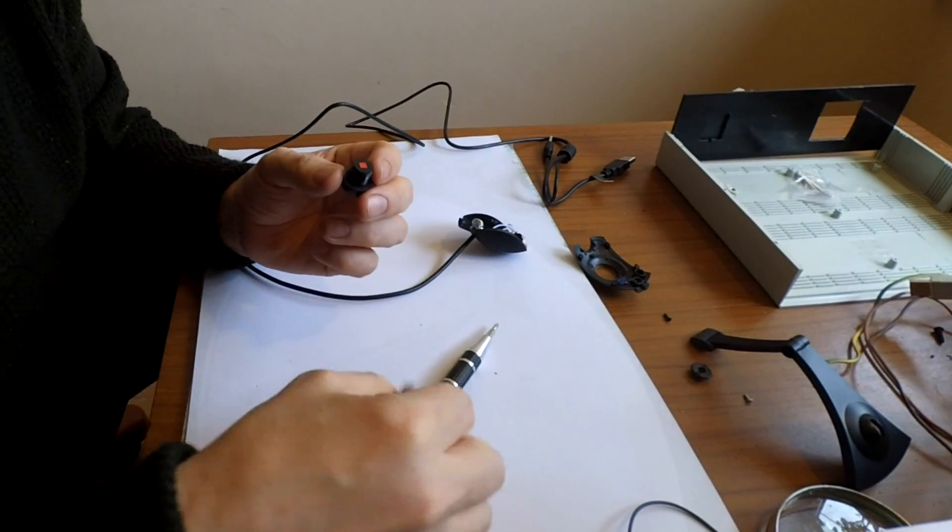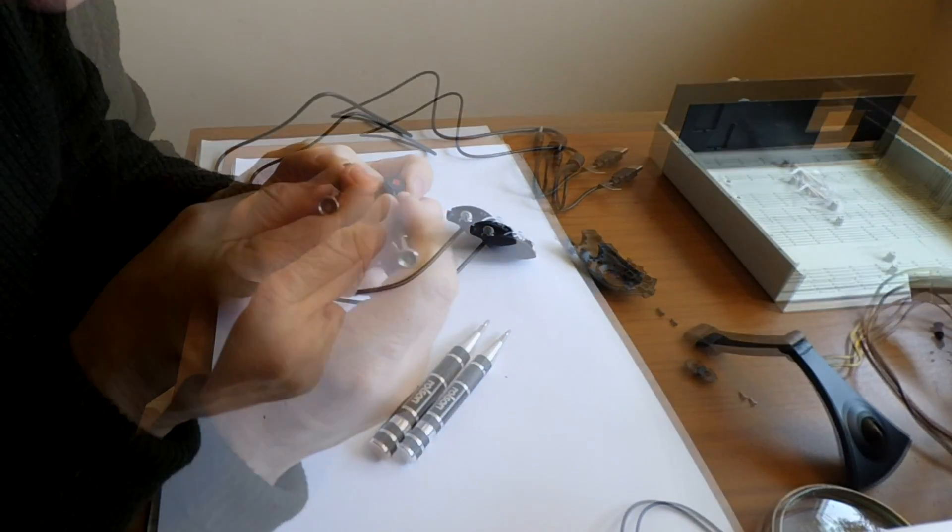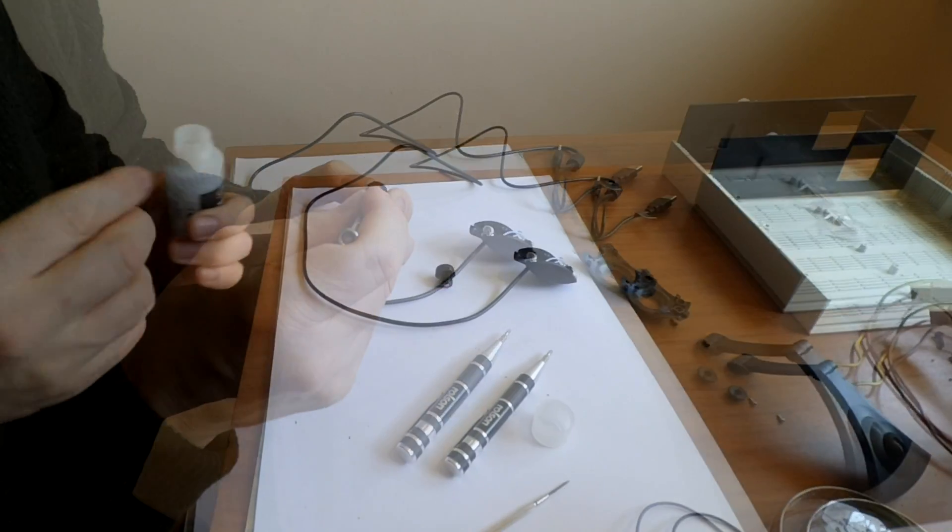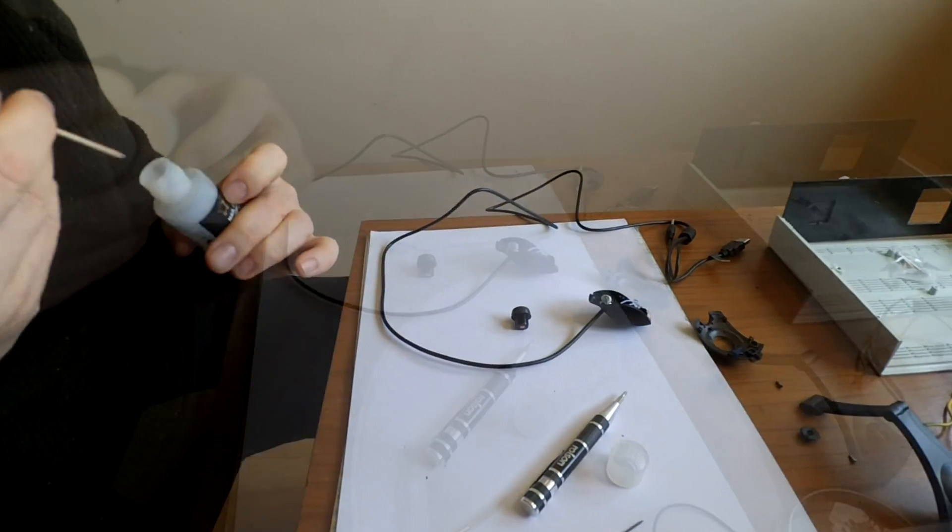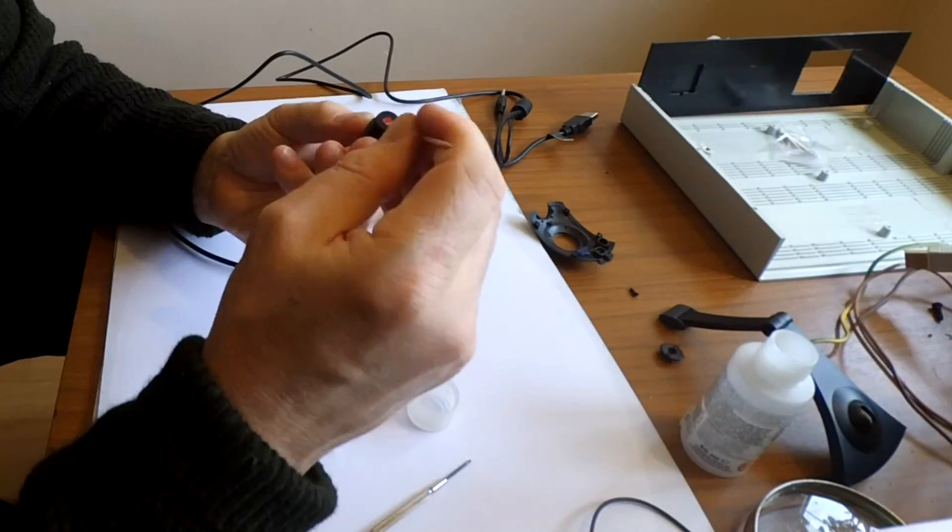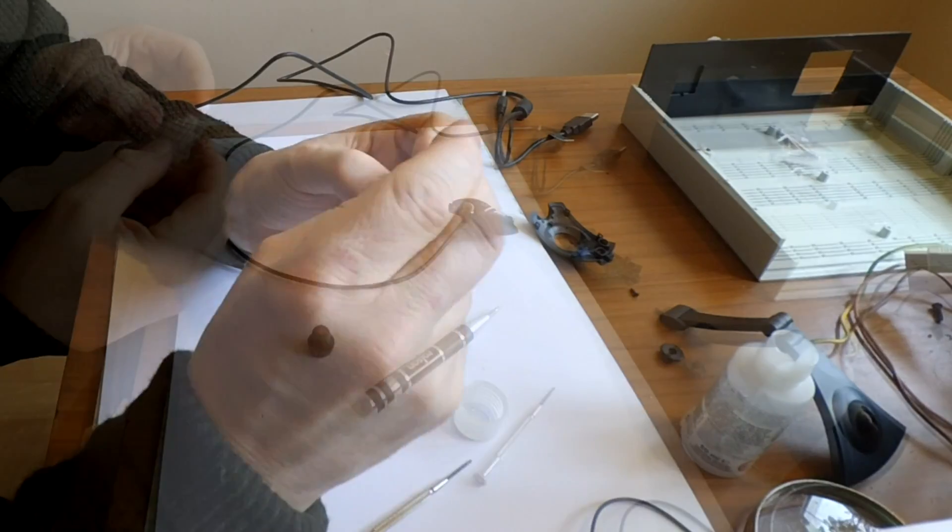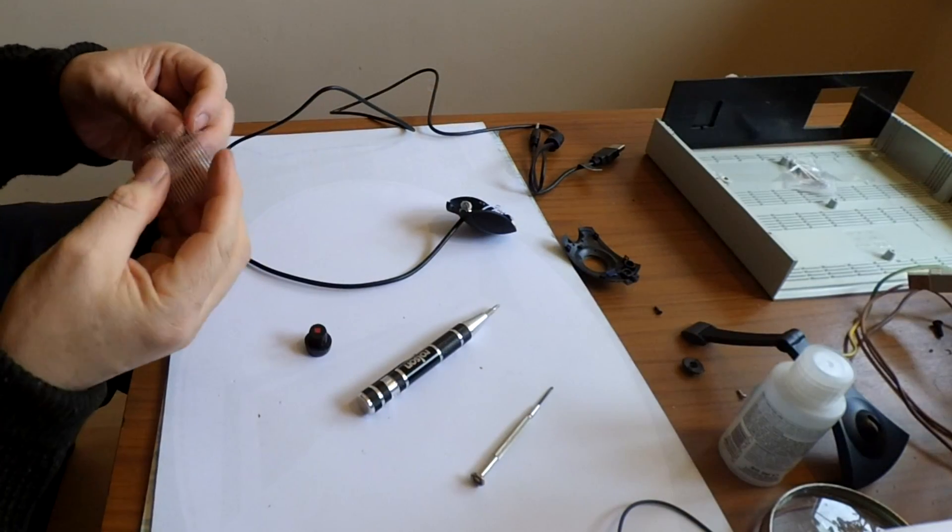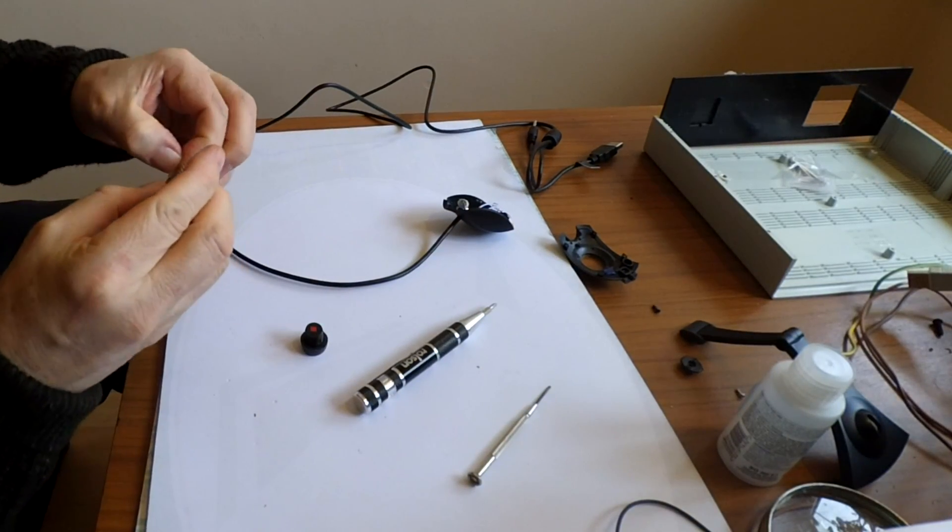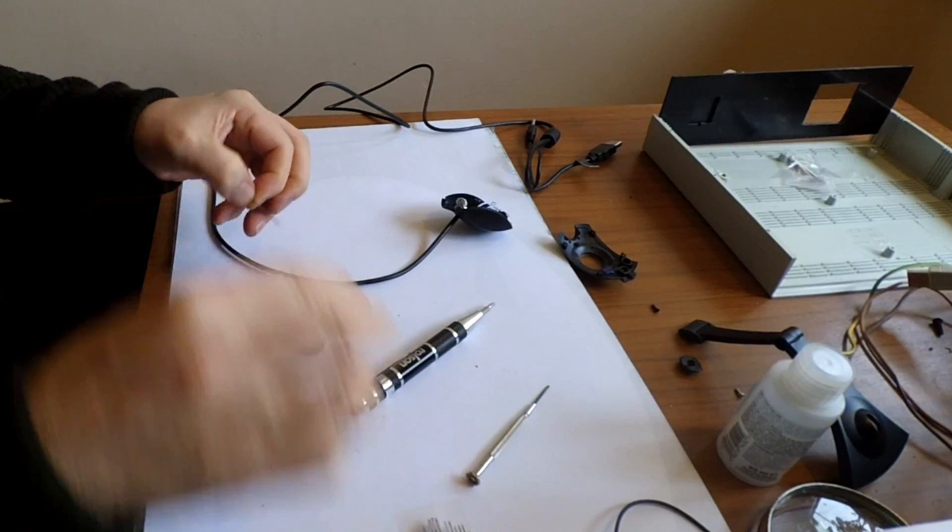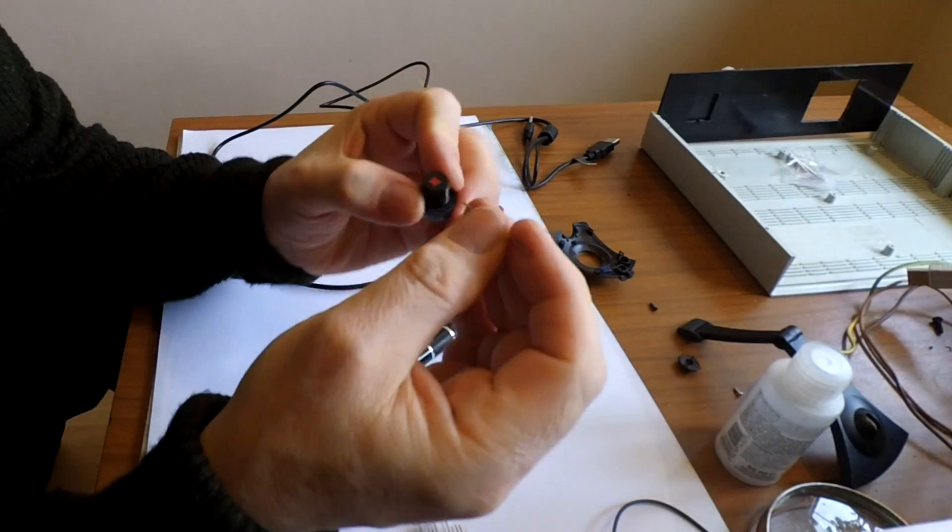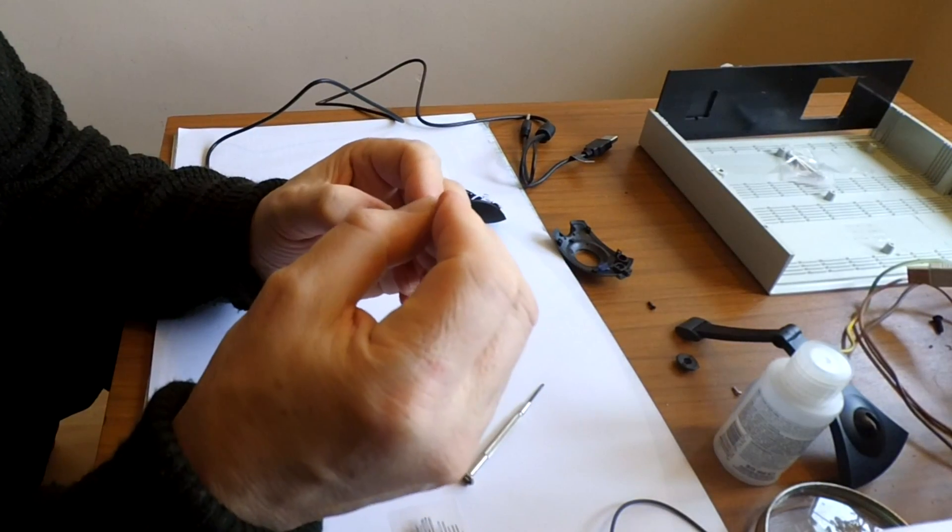I am now going to smash it out. I can see a little dob of glue there. Remove it with acetone. So I'll get one of the big tweezers I've got here. Let's see if I can get in the corner. Each corner has got a little circle.